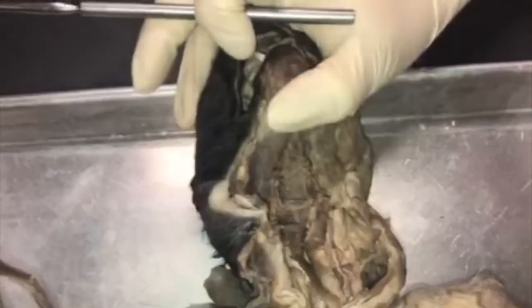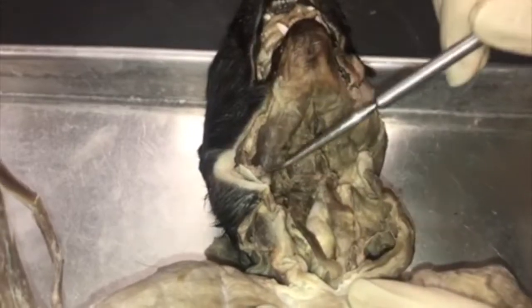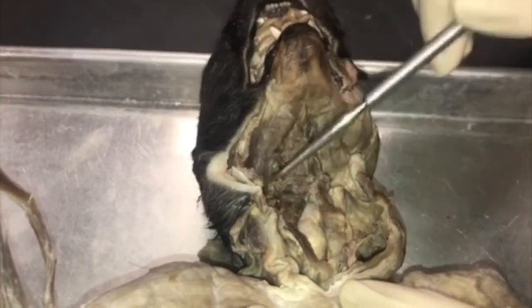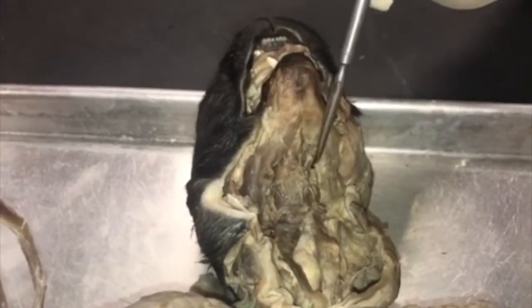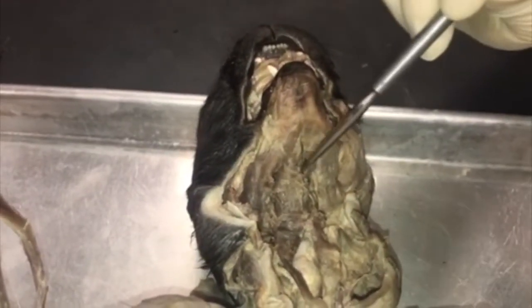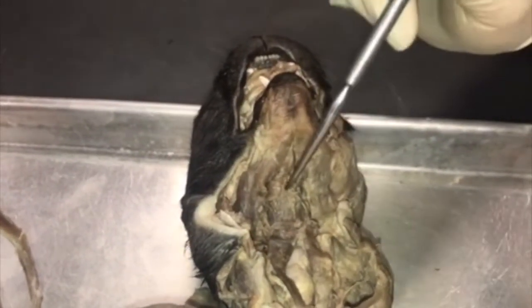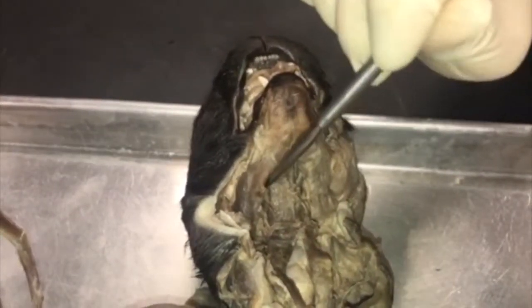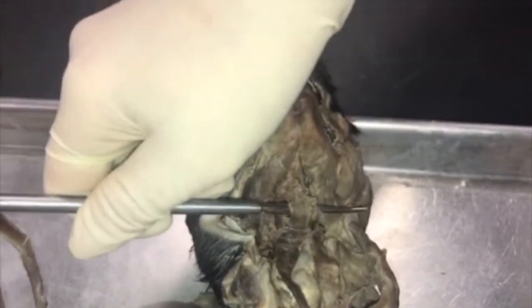If we open the cat up and lay it on its back a little more, we'll expose more of the ventral neck muscles. This muscle here — you have one on each side — is going to be your digastric muscles. If we pull that out of the way a little bit, we'll expose more of this muscle running here. It's going to be running side to side versus up and down — this is going to be your mylohyoid. And if you pull that back, we'll expose this muscle here, which is known as your geniohyoid.